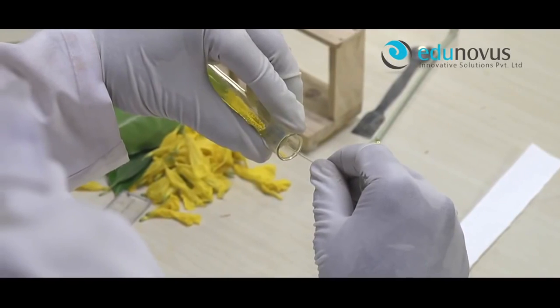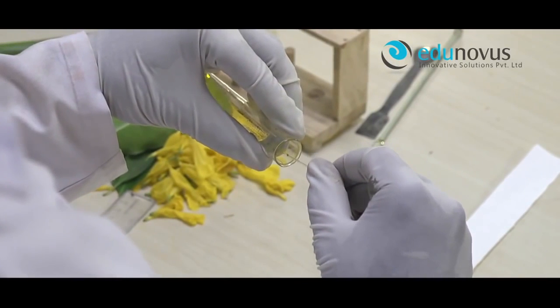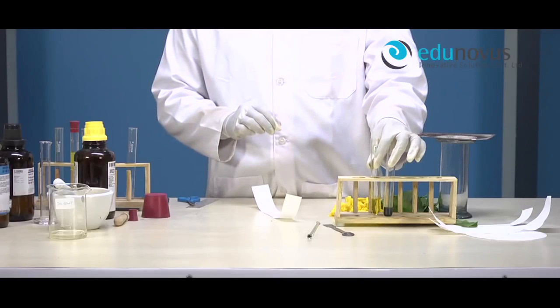Now with the help of a fine capillary tube, put two drops of flower and leaf extract at points A and B respectively.